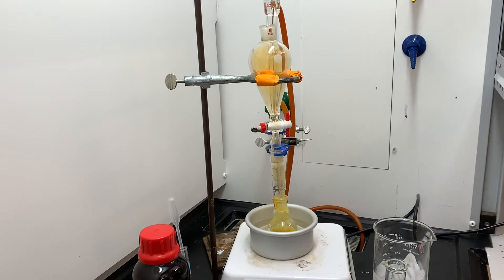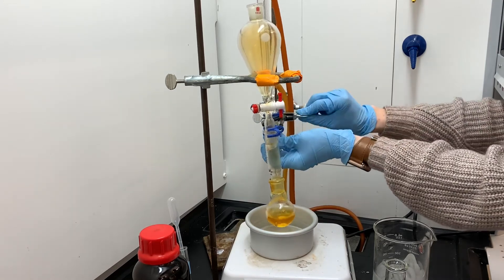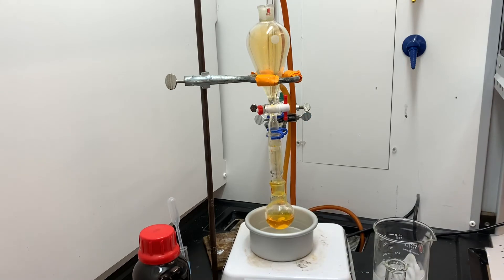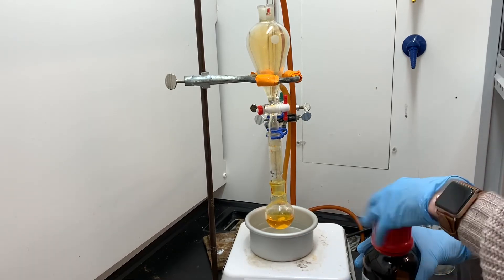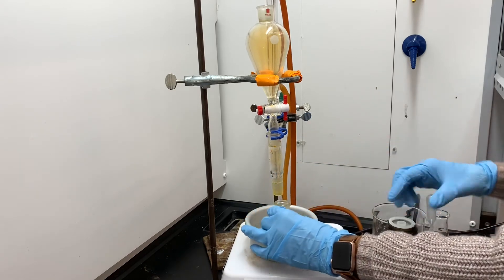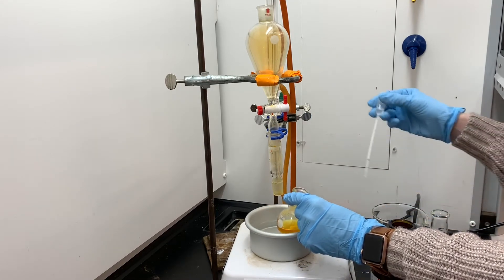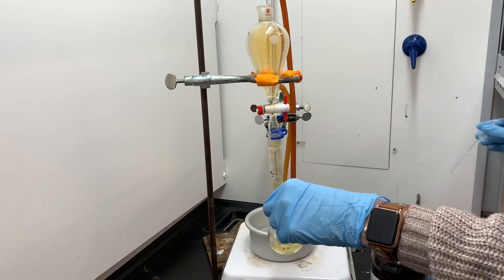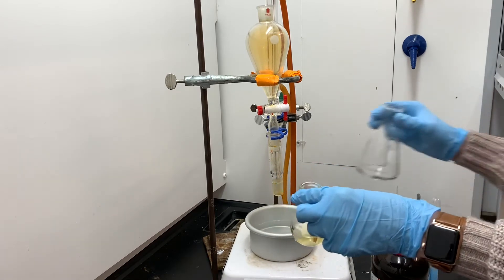All of the bromine has been added to the round bottom flask, and the solution was allowed to stir and react for about 15 minutes. The solution is now a medium orange color, which indicates there might be a little bromine left that has not yet reacted. To clean up the extra unreacted bromine, we'll be adding an inert, non-reactive alkene — cyclohexene. Because it's an alkene, cyclohexene will react with and remove any excess bromine, but it won't react with anything else, so it won't affect our product. Watch the color of the round bottom flask magically turn a very pale yellow — that confirms all the extra bromine has been removed.